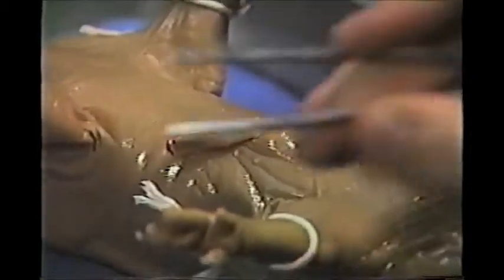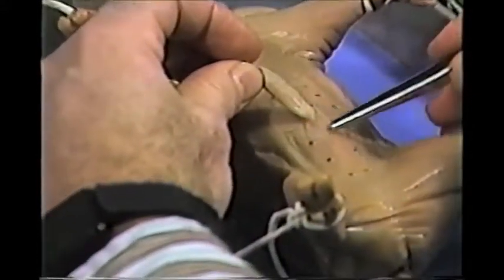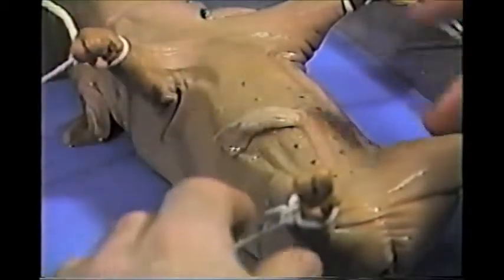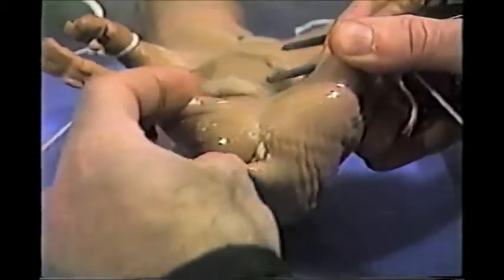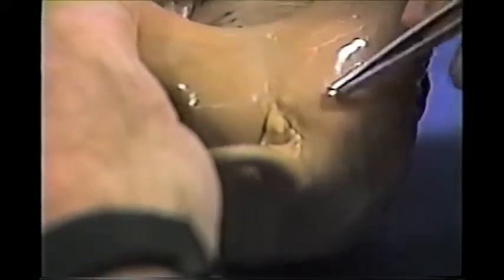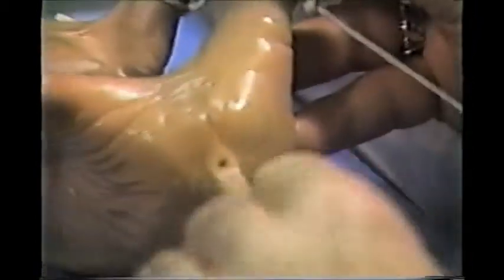If we look at the female, under the umbilical cord there is no puffed up area and no pore. The female has, in the back, right underneath the tail, a little papilla called a genital papilla. And you say, well, gee, this looks more like a male thingy, but it isn't. That indicates this is a female. If we go over to the male, you see the male doesn't have that genital papilla.